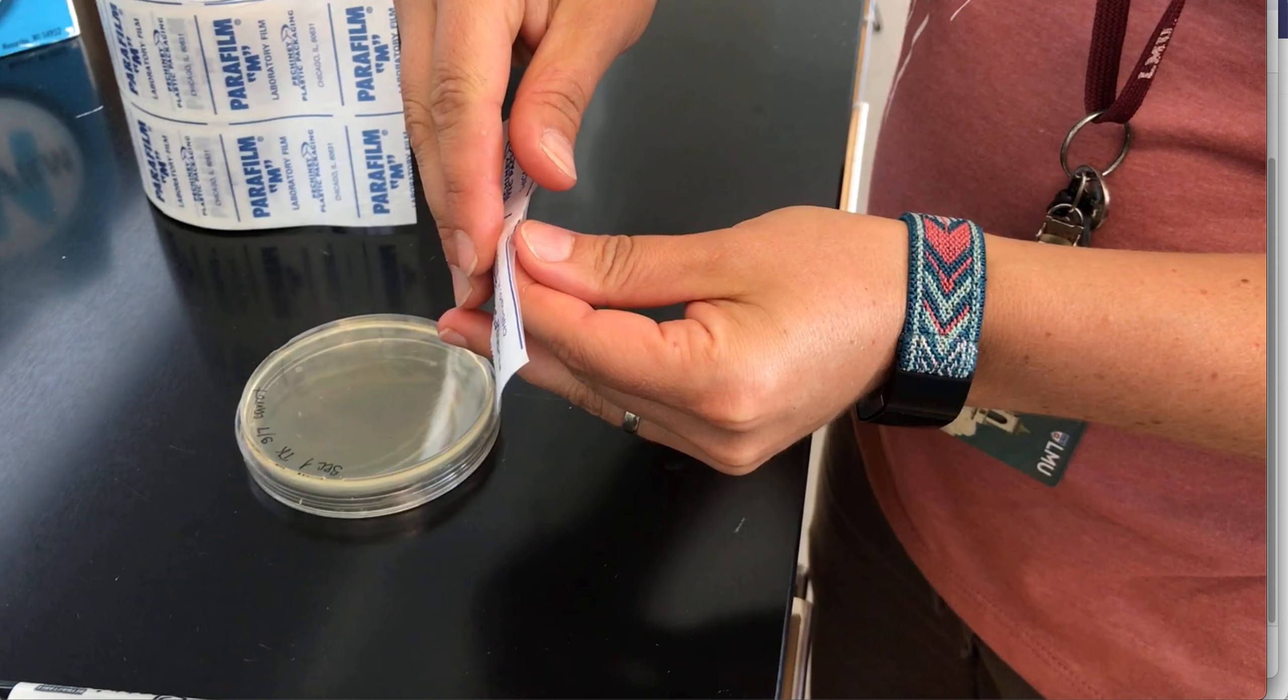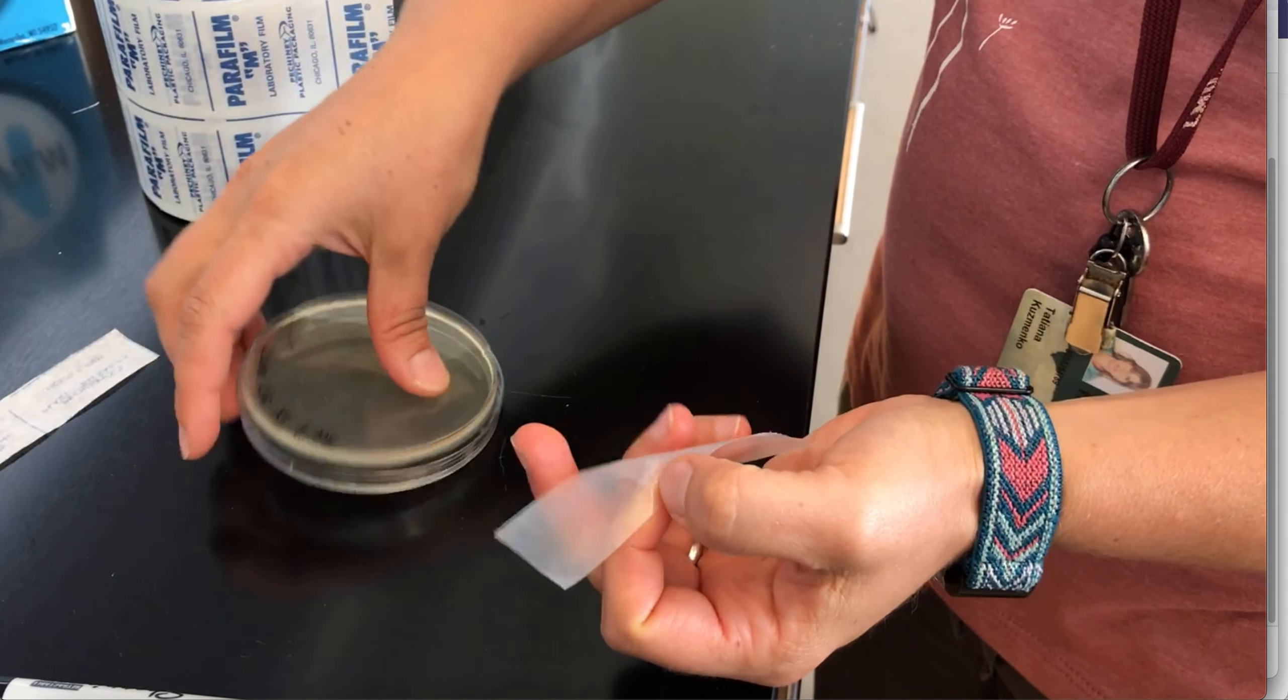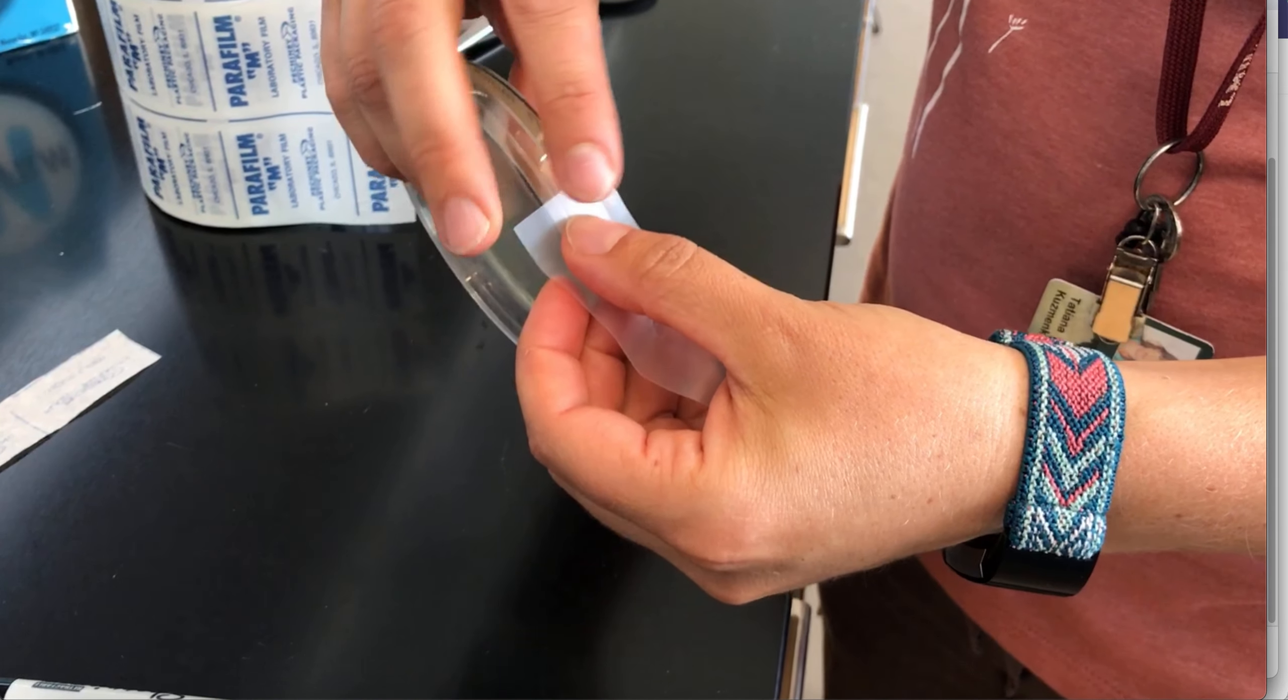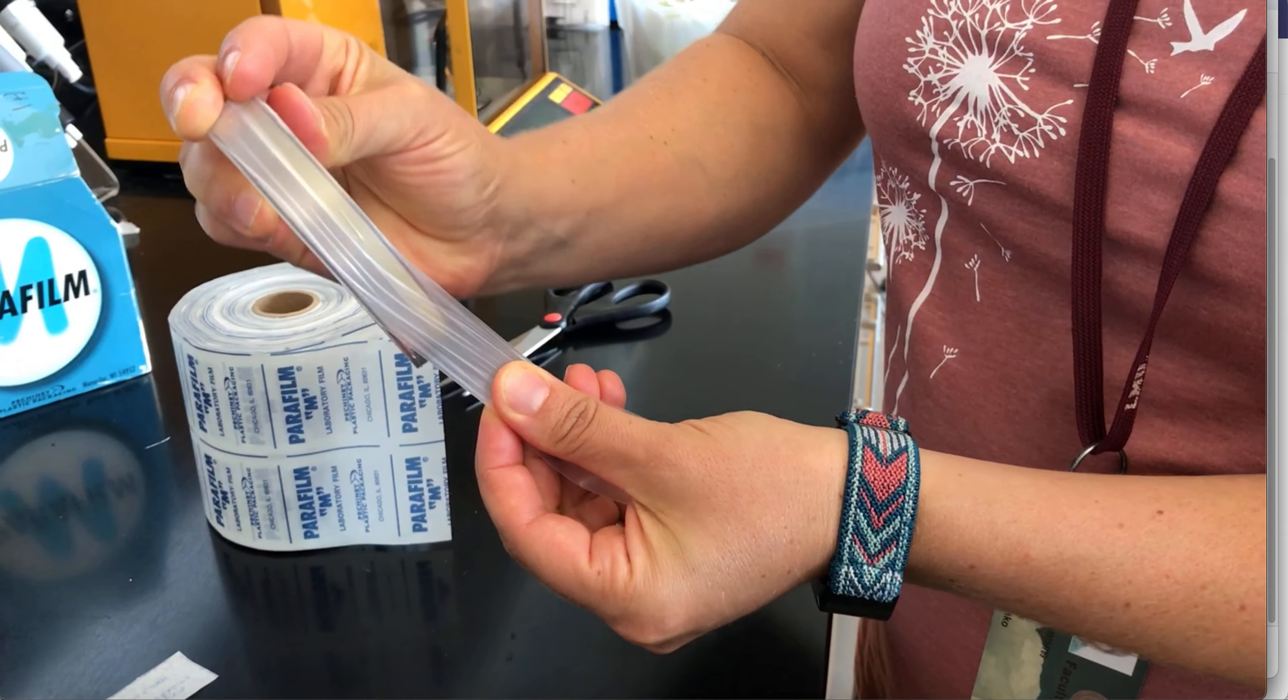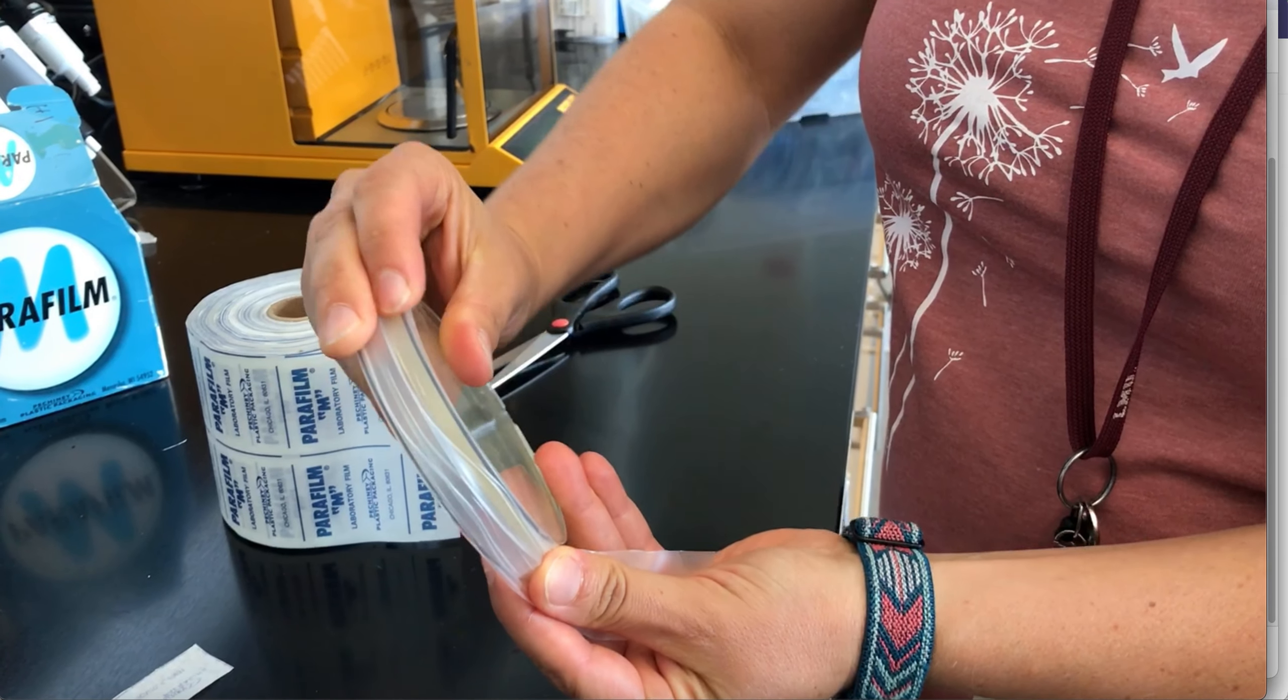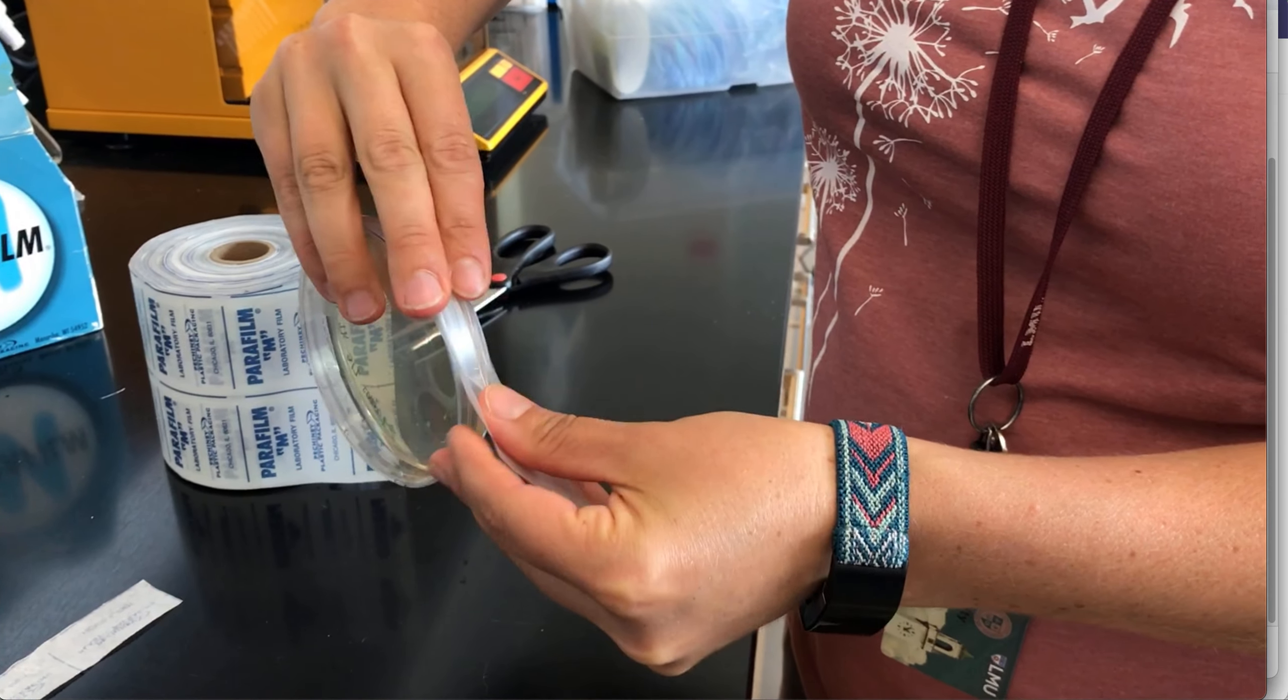Attach one side to the plate and stretch first, then put it on the plate and run your fingers across it to make it stick.